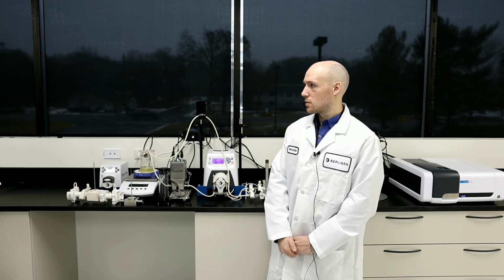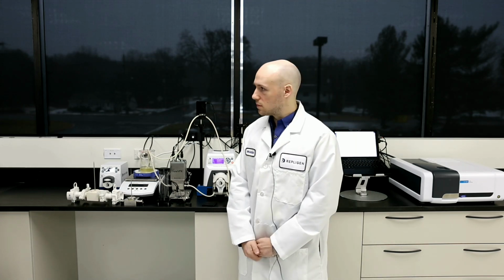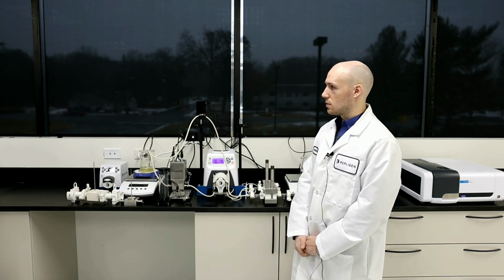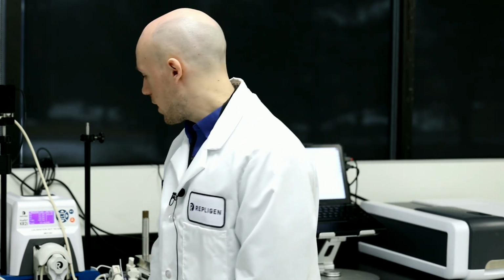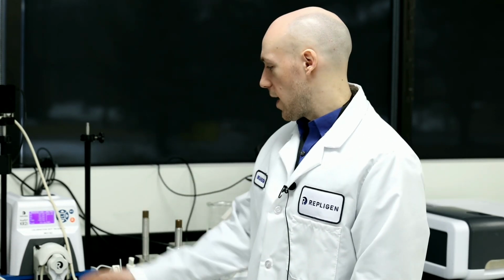And the next question asks more about processing volumes. When it comes to this system and then the larger scale KMPI systems, what kind of processing volumes can we do, basically from max to min? So again, for the smaller system, I would say you can do probably anywhere from 10 liters and lower, just because the max flow rate of this guy is a little bit over 1 liter per minute.